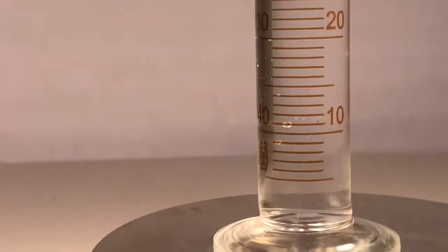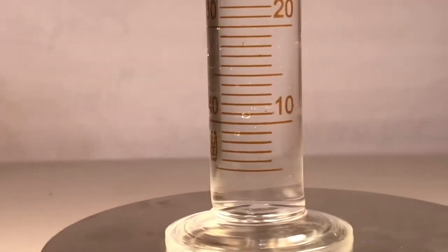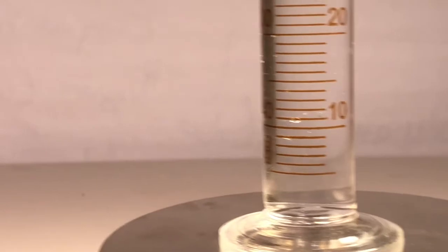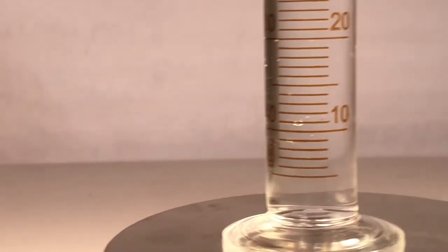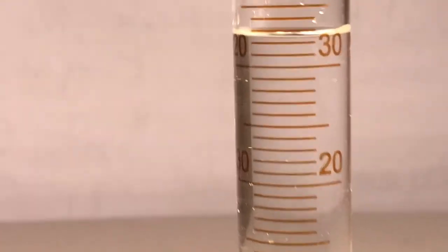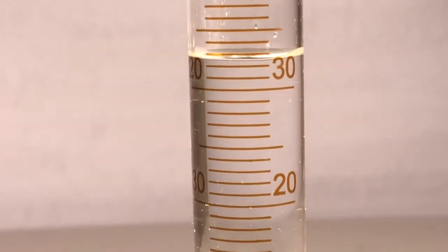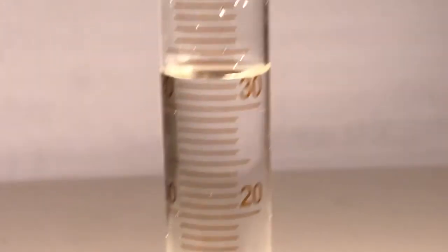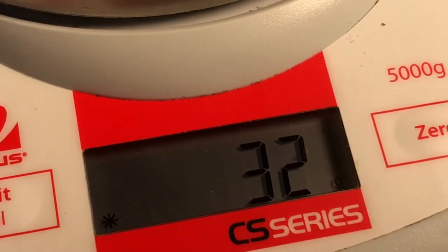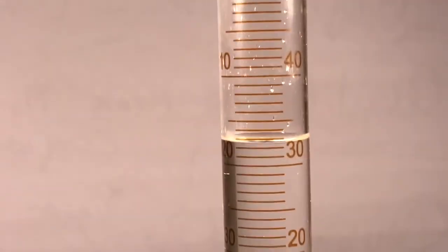And here comes one more. I'll do 1.5 this time, just so you don't get into a habit. This is gonna be 6, I think. What's that? Read from the bottom of that fat whitish line. And now take that. And here comes 6.